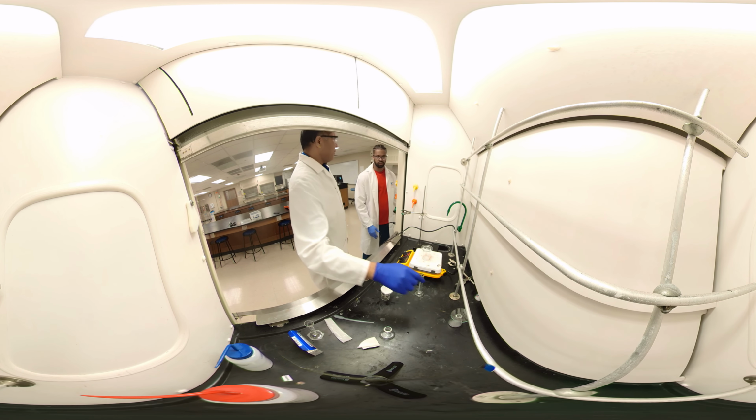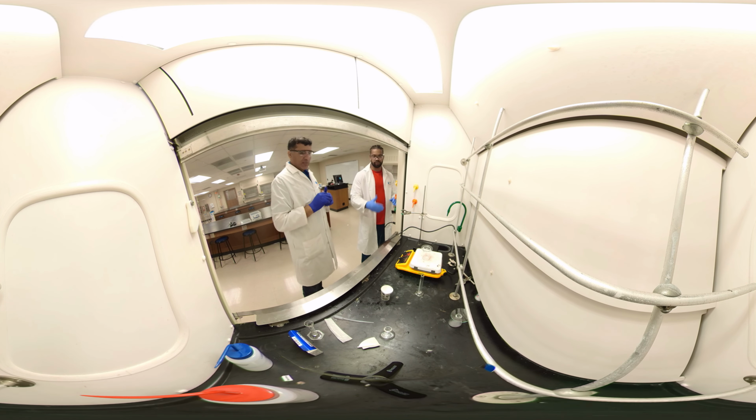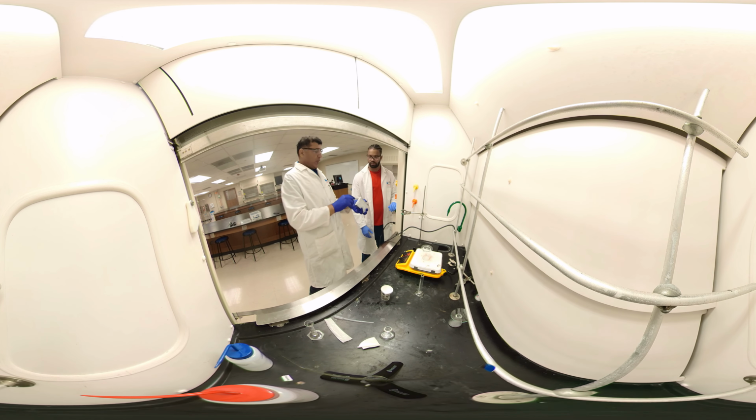Okay. Then in this liquid, the very first beaker, we have 2 compounds. So we'll separate those 2. So total we are making 4 solids separate. And Goody's powder has 4 components here. We are separating all of them one by one.